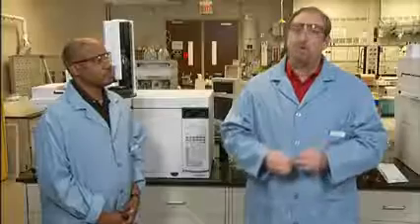If your splitless injection purge time has changed for some reason, you could see a shift in retention as well. Check to see that all the settings are correct, and if needed, change them. Lastly, the obvious reason for retention time shifts would be a change in temperature. This can be tricky since in a temperature program run, which is what most analysts are doing, any change in flow is also a change in temperature.